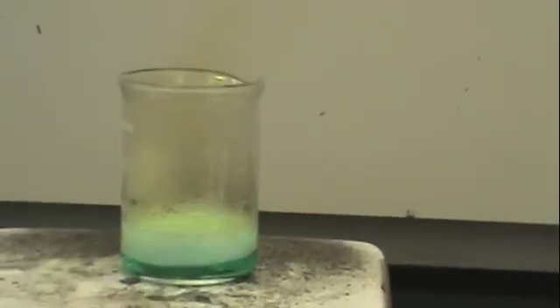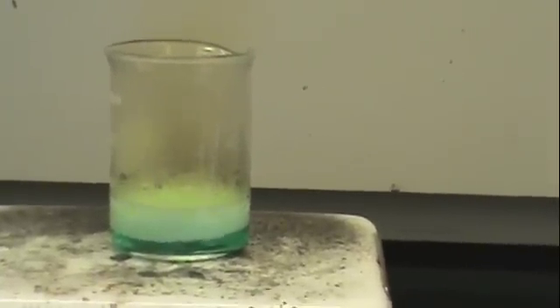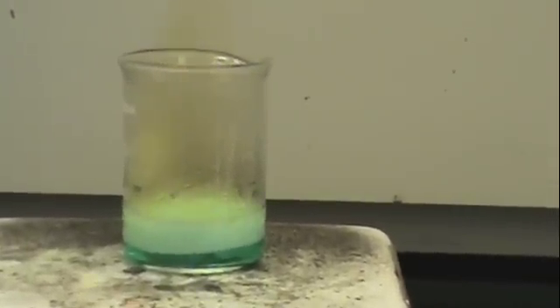You will also notice that the solution becomes darker turquoise in color and bubbles vigorously. You should also record these observations.